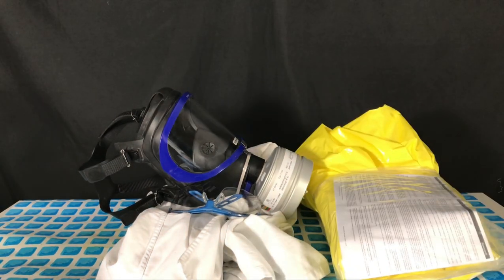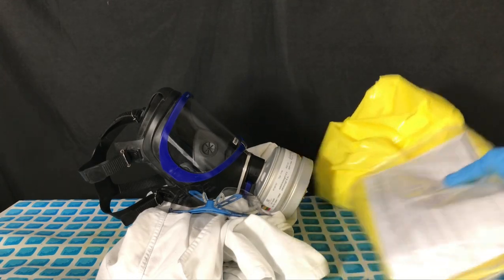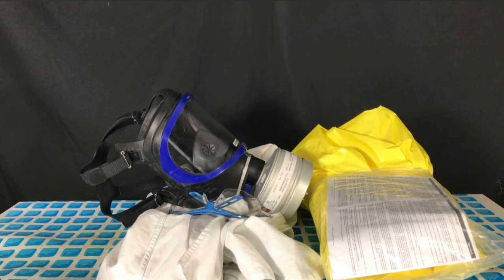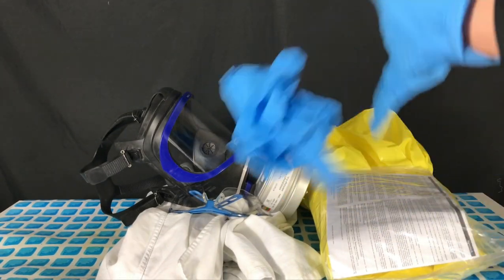As you are going to see later on in the video, sulfur trioxide readily evaporates, forming concentrated sulfuric acid vapor. Therefore we had a full body chemically resistant protecting suit available if the fuming got out of hand. Two pairs of nitrile gloves were worn throughout the procedure.